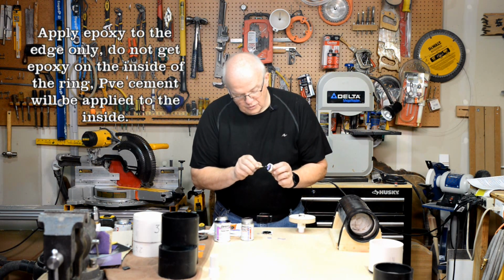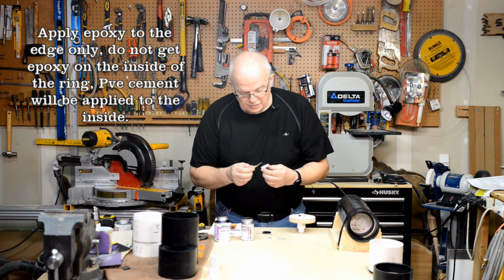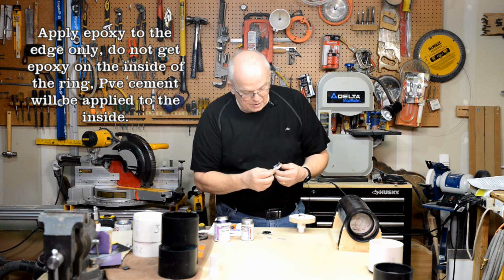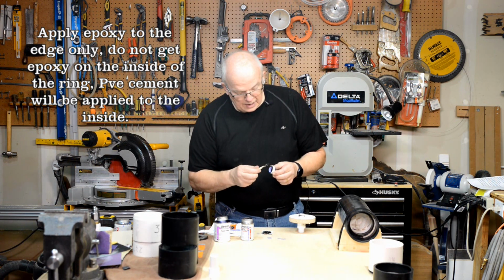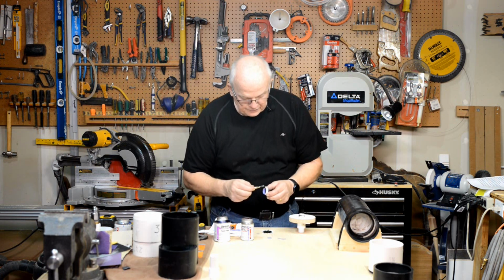Build it up. Don't worry about being pretty. You do this right and you won't have to worry about it. I've got a nice thick layer of epoxy on the edge of this. And again, it's important that you get it all the way around. Don't leave any open spots. Don't leave any thin spots.